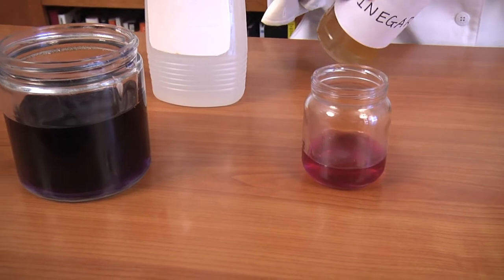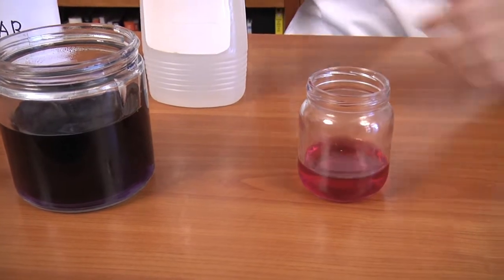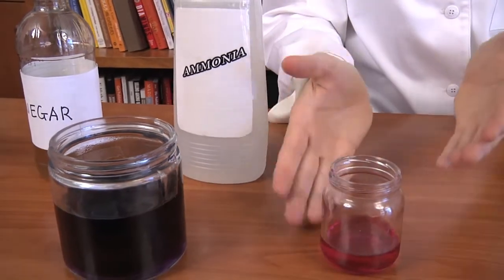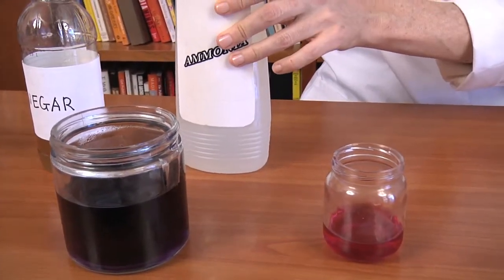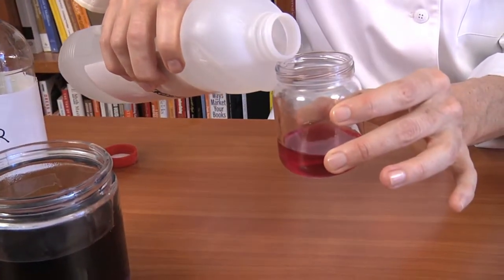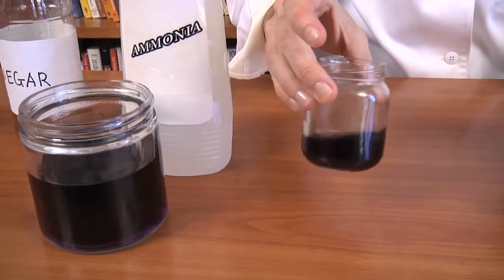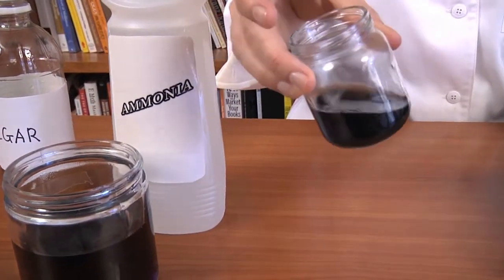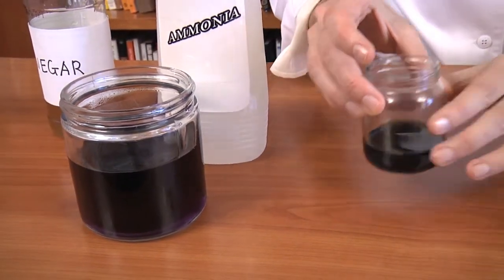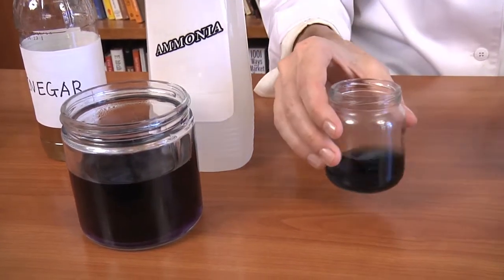And indeed it does — it turns a nice bright pink. Now I can observe what happens when I add ammonia. Ammonia is a base and it's going to react with the acid in the beaker. And when the color changes, I will know that the reaction has gone to completion. So if I add just a little teeny bit of ammonia, I can see that it starts to react. And in fact, I've already added so much ammonia that the solution turns green. This tells me that I've already gone past the full reaction — it was an acid, and now it's reacted with a base, and there's excess base in my reaction beaker.